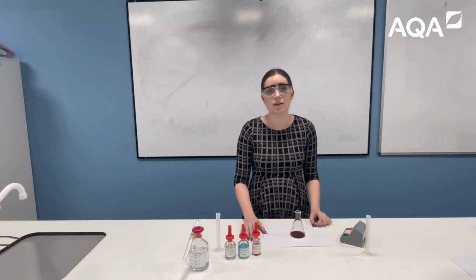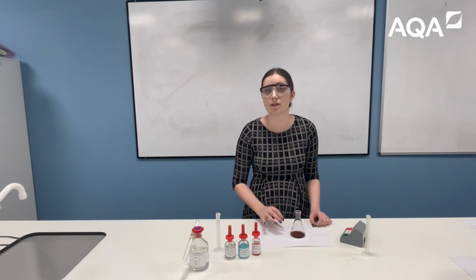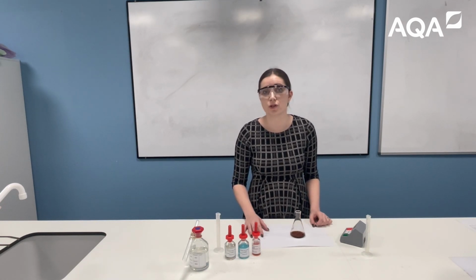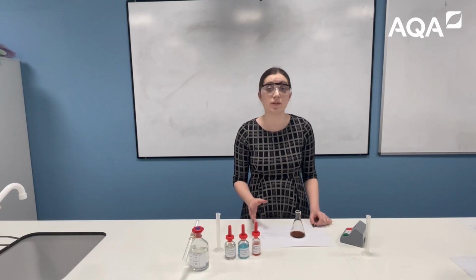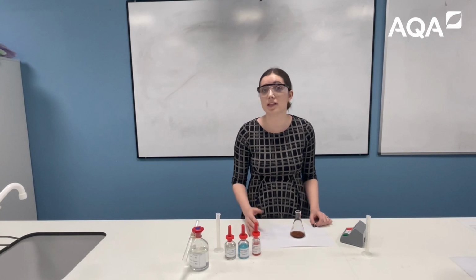If pre-planned, this experiment can be planned so that the cross appears in a very specific set time. And it can also be an exciting challenge for students to experiment with different concentrations and see if they can get the experiment to happen in a specific amount of time.